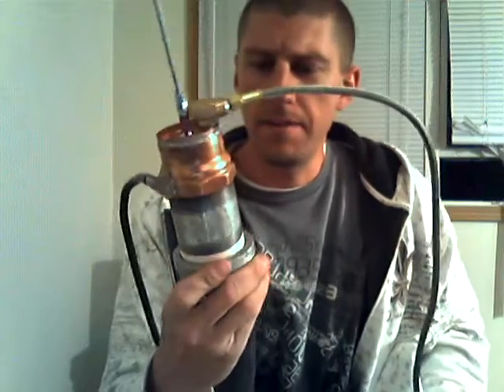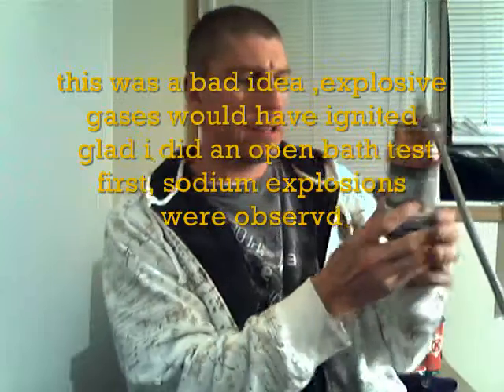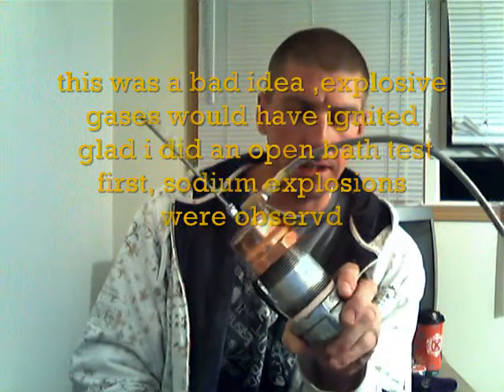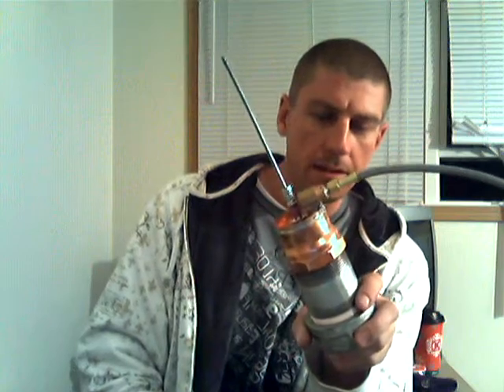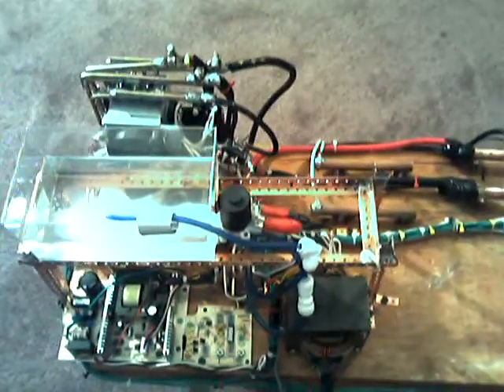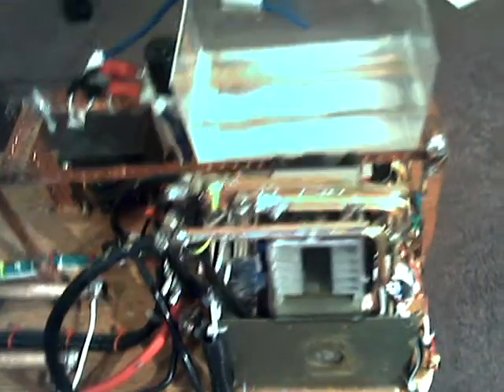I've got about $45 worth of parts right here. This is an electrolysis cell that generates sodium metal and hydrogen gas by electrolyzing a molten bath of sodium hydroxide, which is provided by Lowe's. Here's the power supply that I built to do this with — this is not the only thing I'll be using it for. Unfortunately, 8.45 volts is not good at all for this; it's getting it way too hot.